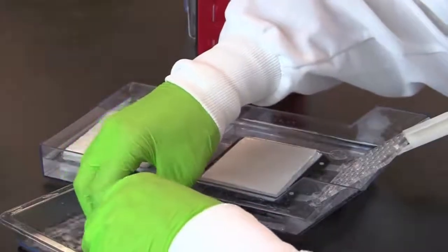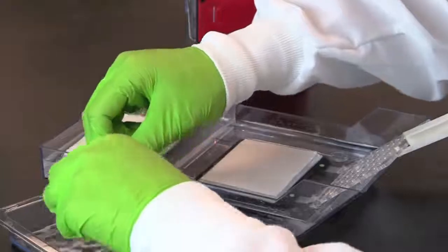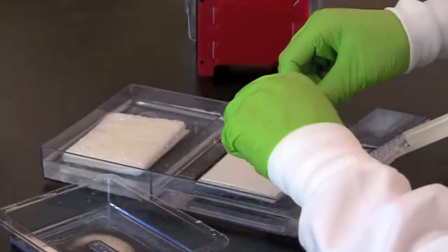Take the gel and carefully place it squarely onto the blotting paper, again being careful to avoid any bubbles between the gel and the blotting paper.